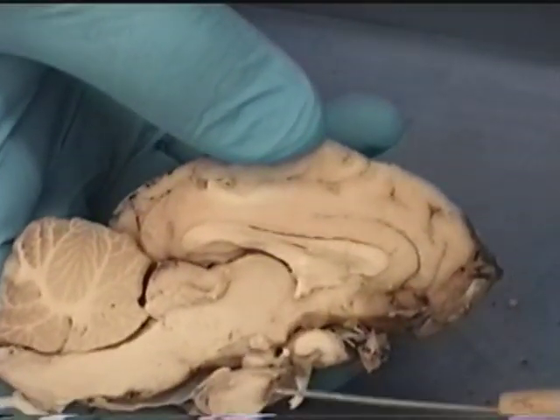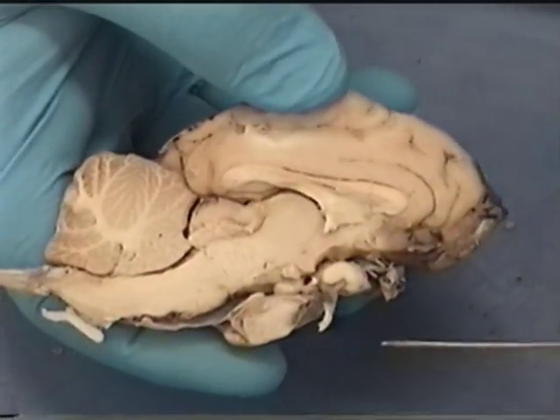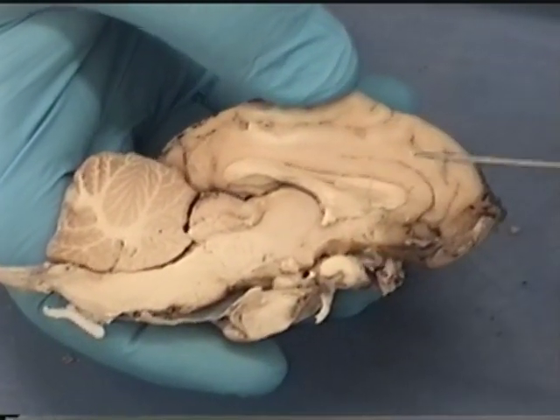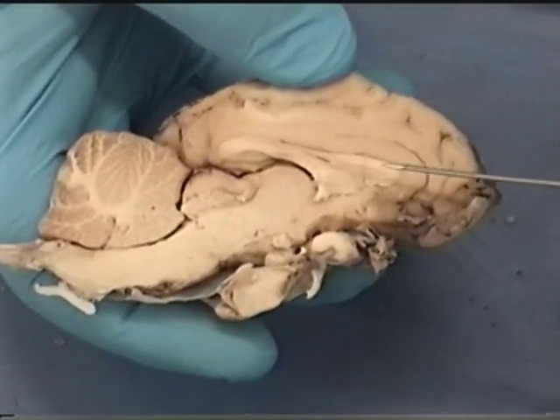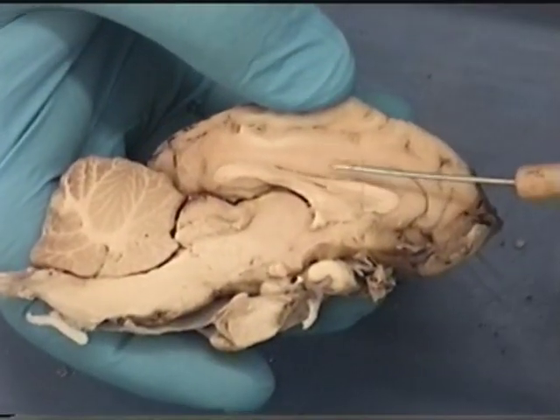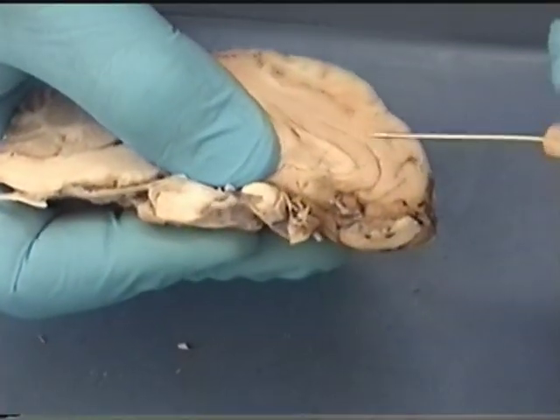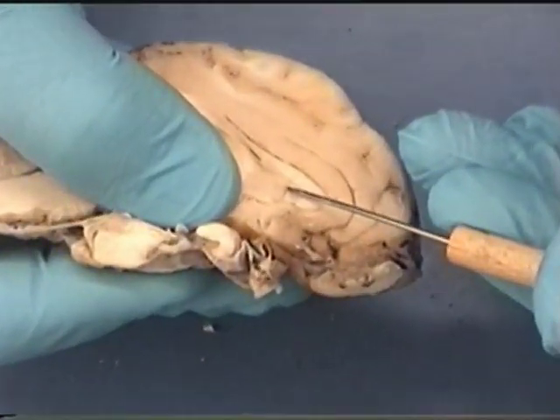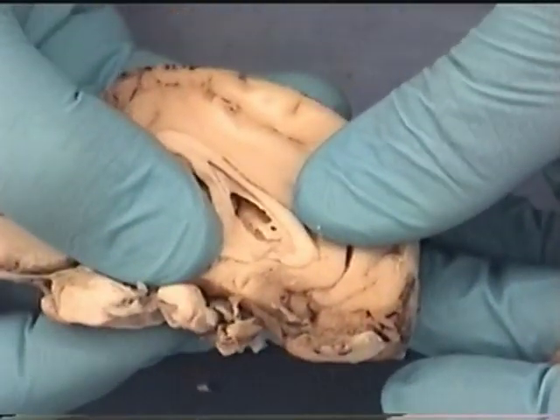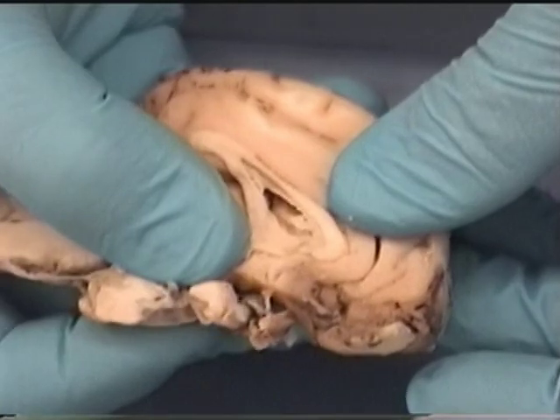If you look at a mid-sagittal section of the brain, we can see the same structures as in a human brain. This half-moon structure is the corpus callosum. This downward projection is the fornix. The tissue between the two is the septum pellucidum. If we tear the septum pellucidum and open it up, we can see the cavity behind it — that's our lateral ventricle.